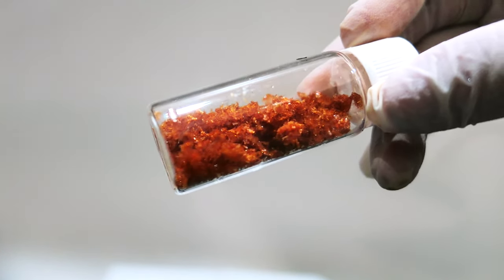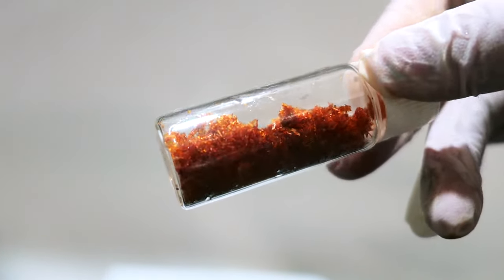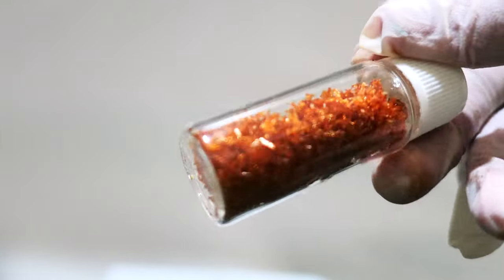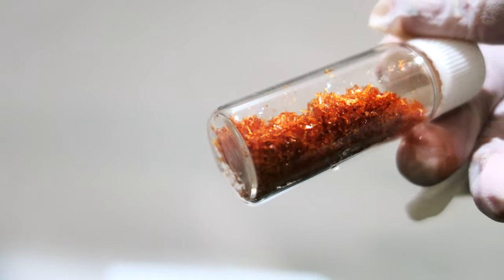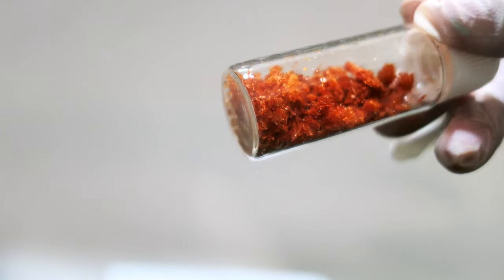In this video, I'm going to make this compound from elemental iodine to iodate, then convert it to periodate, then finally combine with copper to form the target complex.